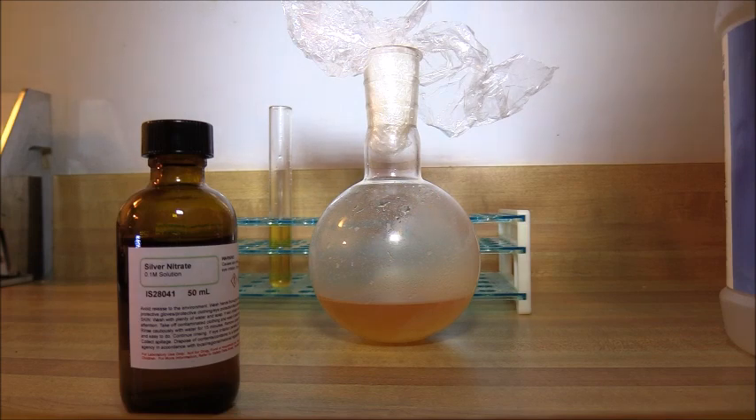Hello YouTube. In November of last year I posted a video in which I attempted to create the purine nucleotide bases adenine and guanine from a solution of formamide using two catalysts. In this experiment I took 60 milliliters of formamide and heated it to 150 Celsius in the presence of sodium pyrophosphate and calcium carbonate. I also blasted the solution with 72 watts of UVC. Upon performing the purine test using an ammonia solution with several drops of silver nitrate, I got a brown precipitate to settle out.